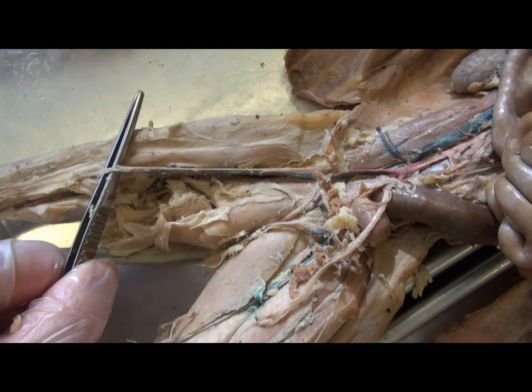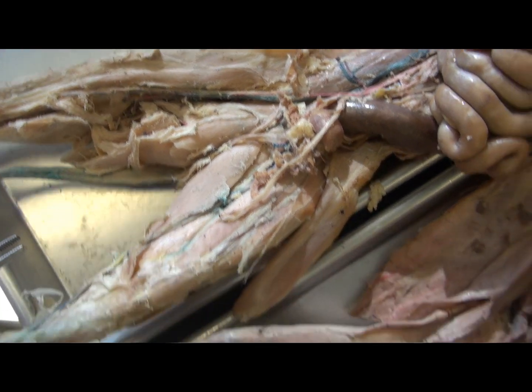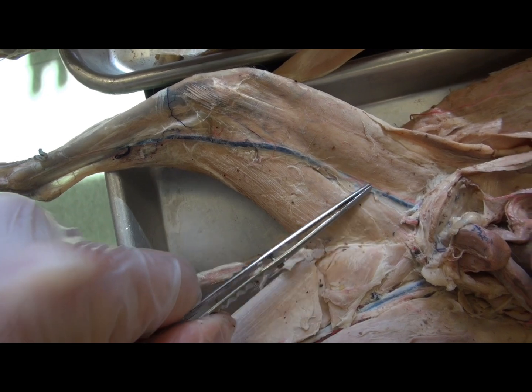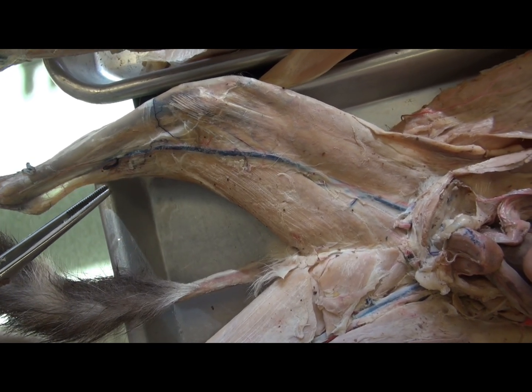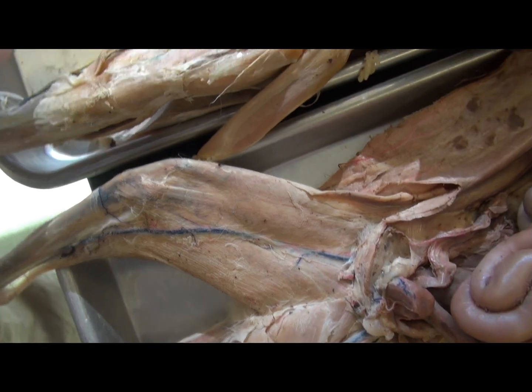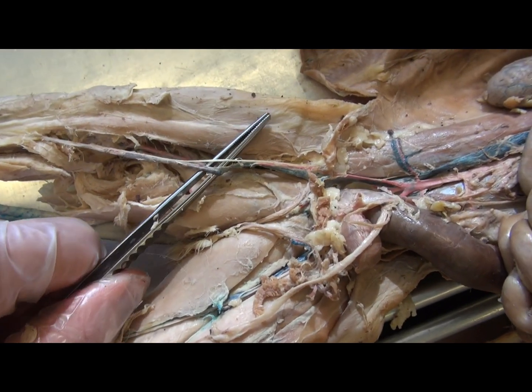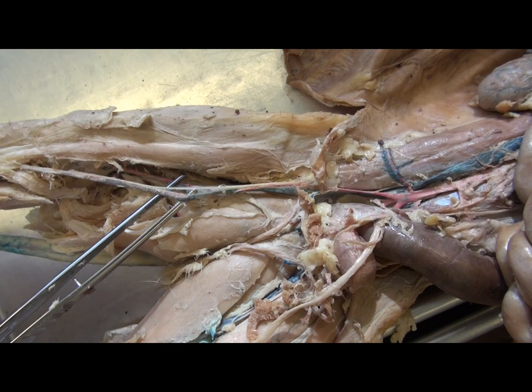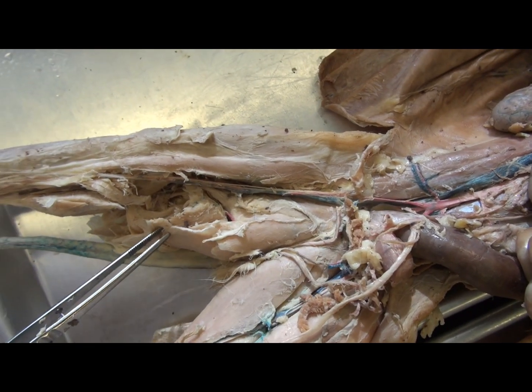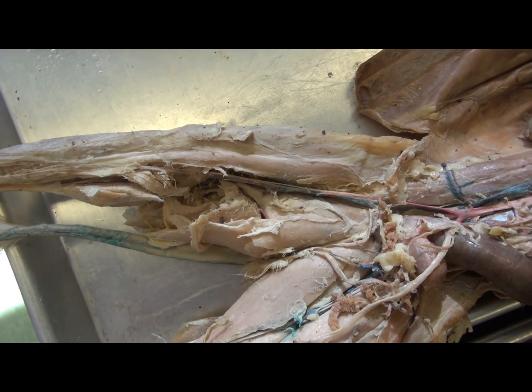There is also an alternate route back from the lower limb — a very superficial vein known as the great saphenous vein. Even before muscles are dissected, after the skin is removed, this vein is so superficial that it is immediately evident. The great saphenous vein proceeds from the foot and joins the femoral vein near where it passes through the body wall, providing an alternate route back from the foot.